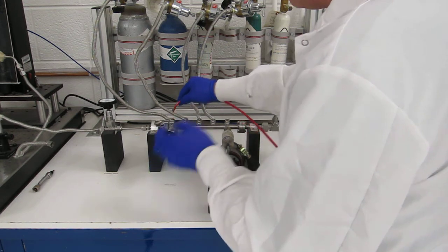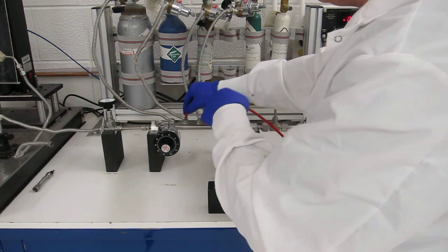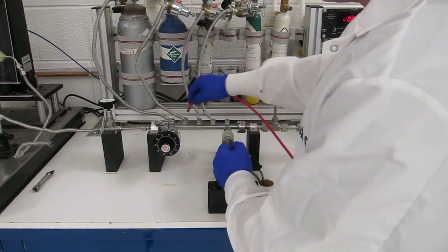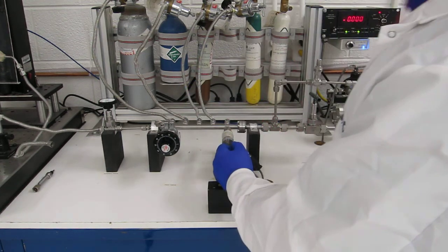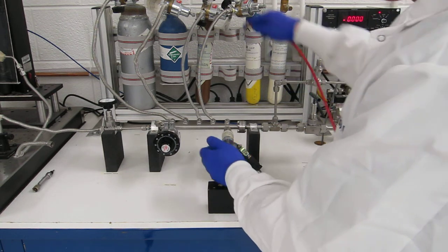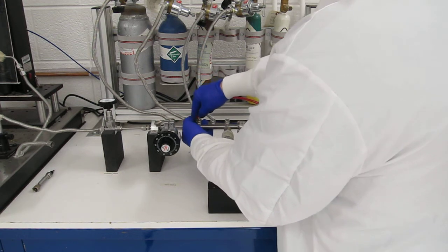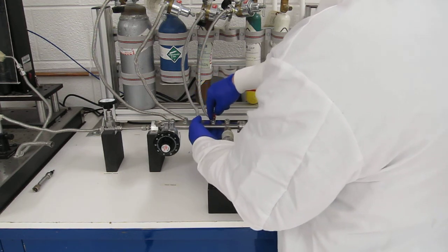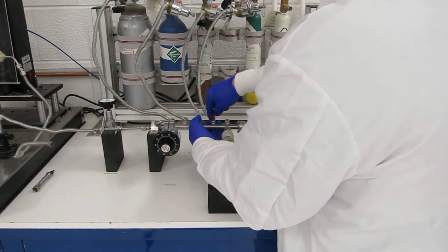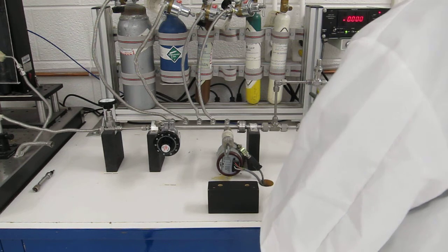When you get near a small leak, and even a very, very small leak, you'll notice that the helium levels will dramatically increase, and when you remove the helium, the levels go back down. So it's simply a matter of wafting helium over each suspect connector while watching the mass spectrometer. If the numbers go up, you found your leak. When you pull it away, if it goes back down, that's it.